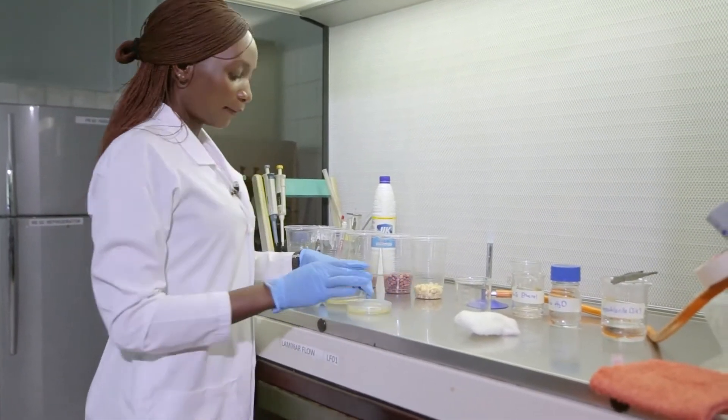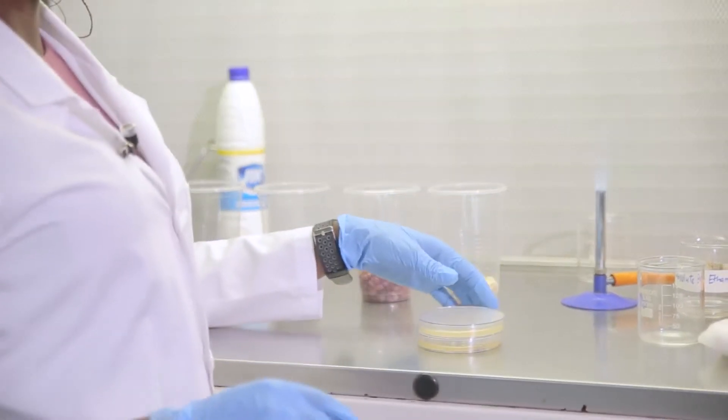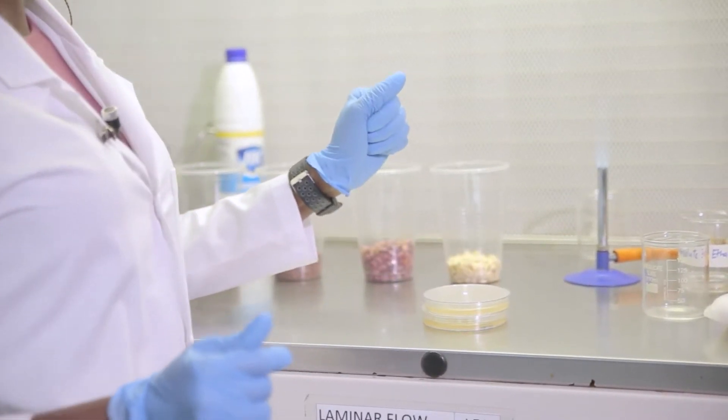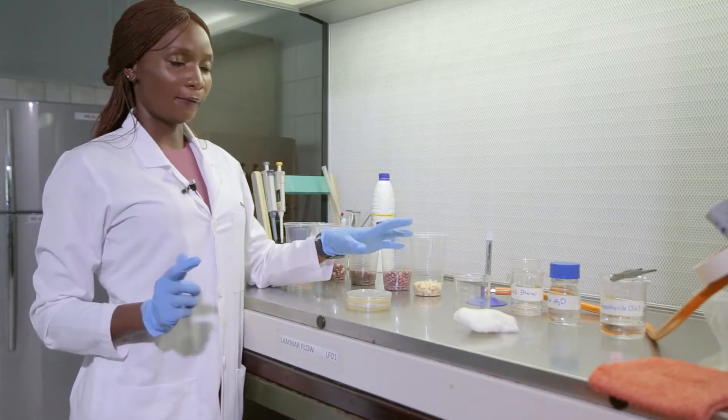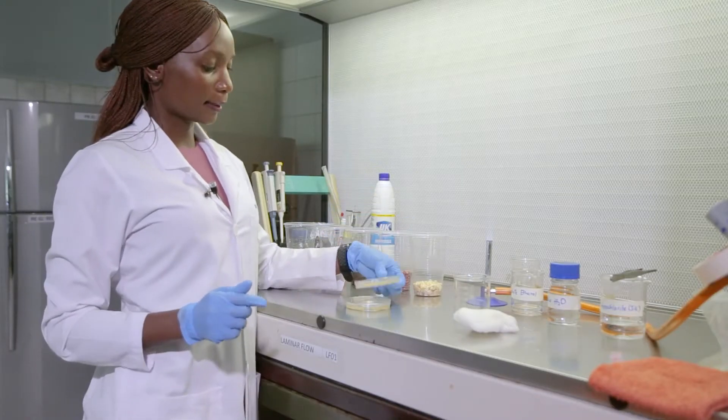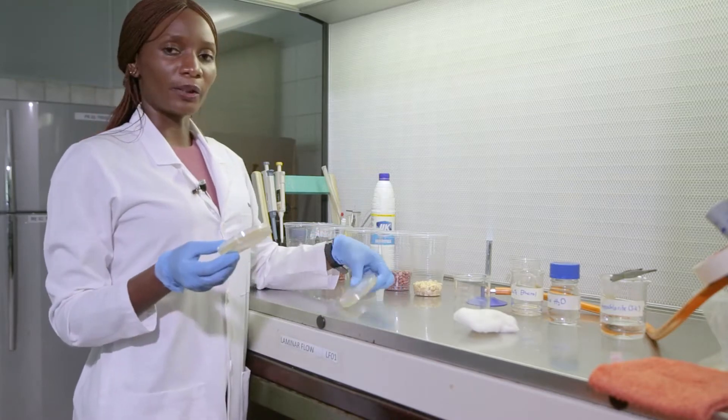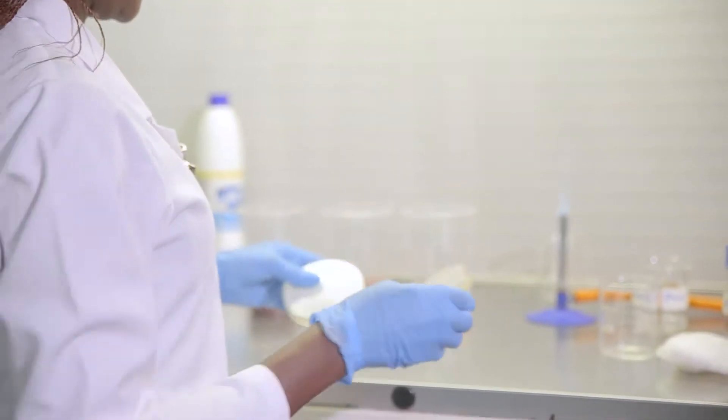What I also have here are plates of culture media. We are going to use the fungal growth medium, that is potato dextrose agar that has been acidified with 1% lactic acid. So the agar is already on the plate. I'm going to work with pre-poured plates.